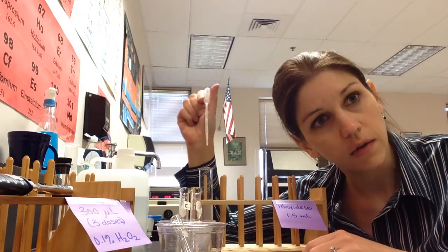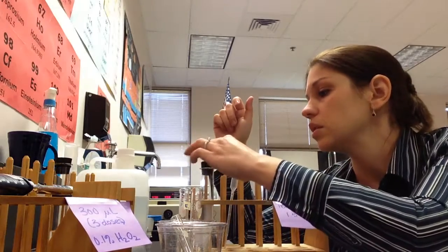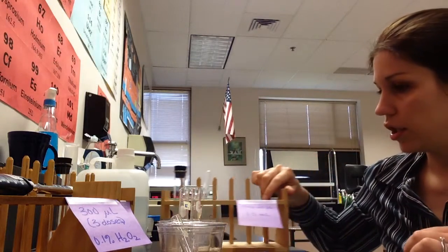Don't take this with you, leave it here. Otherwise, we end up with cross-contamination because people bring them from other places in the room. Okay, good to go there.